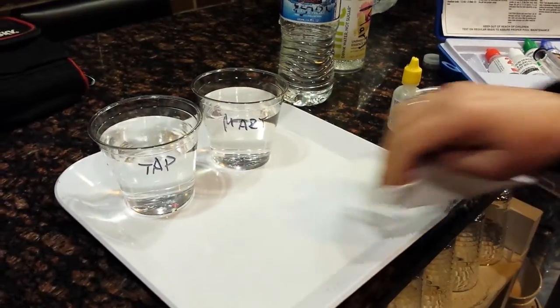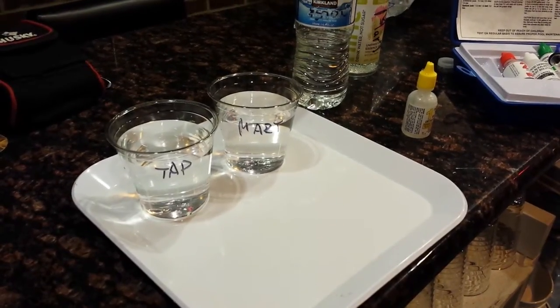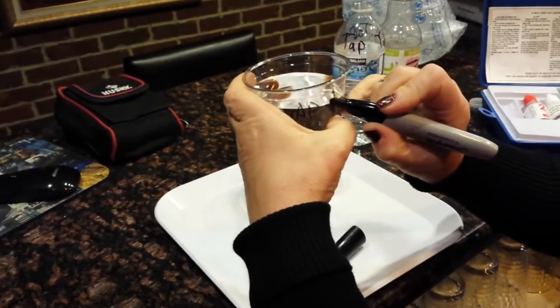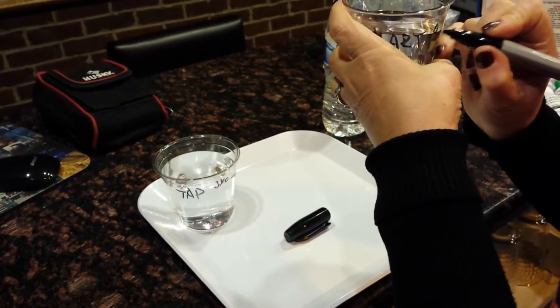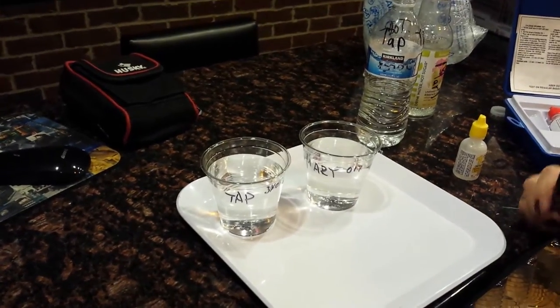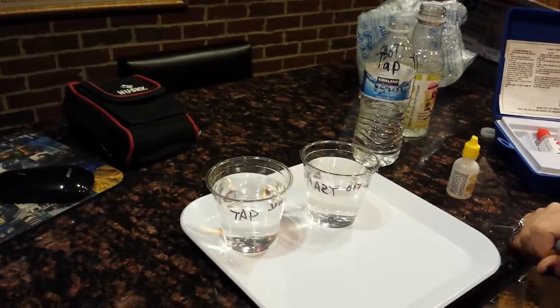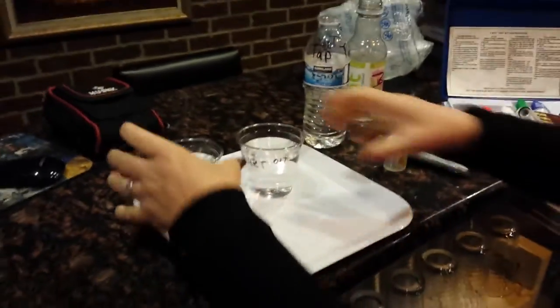Okay, 300 or 340 is too much. Now we will see the electrolysis test. Here is 340 on the tap water. Wait — wasn't that number larger than the water we pulled out of our own system? You know when we were cleaning our water — the good stuff goes through the system, the rest stays back. Ours was 216, so this is actually worse. Yeah, worse. Oh my god.